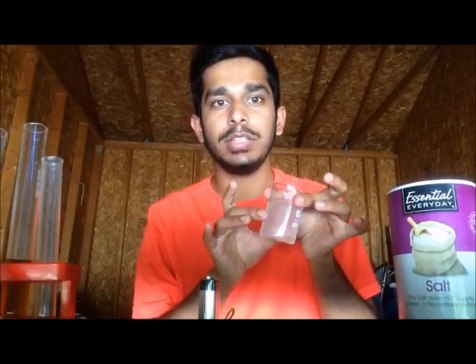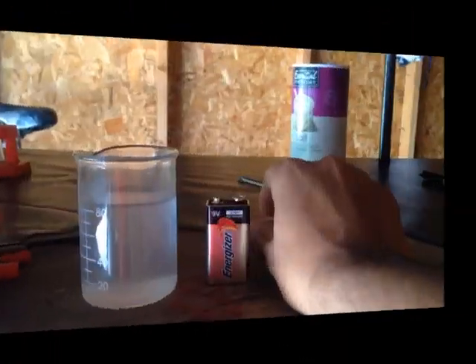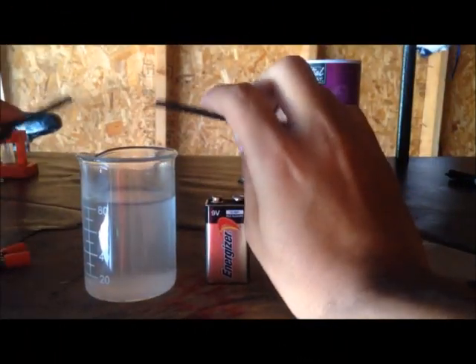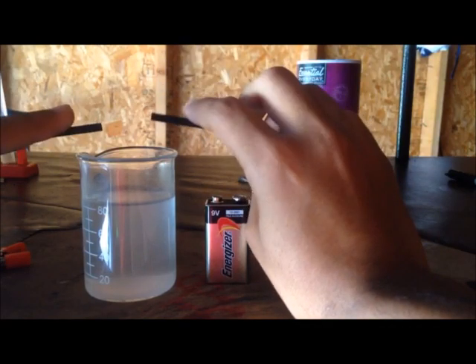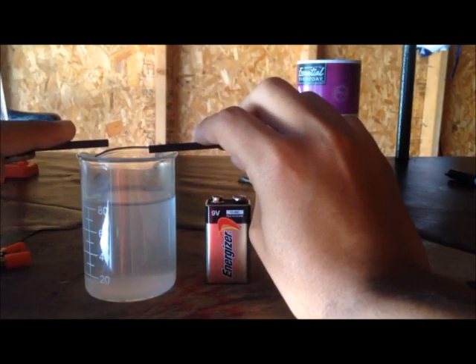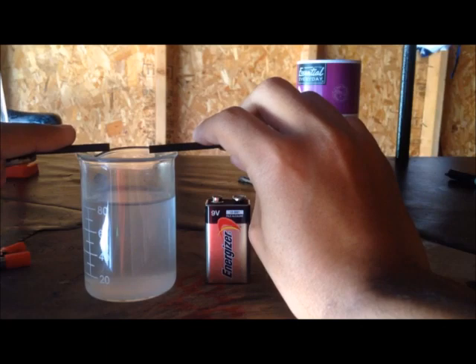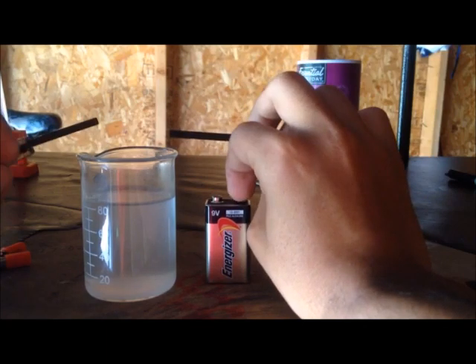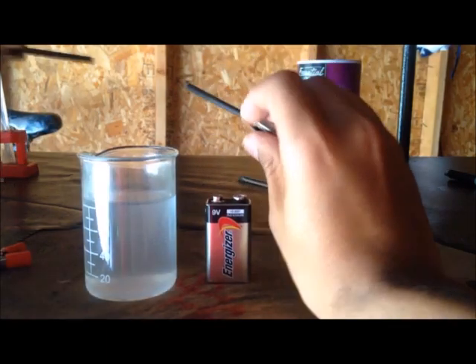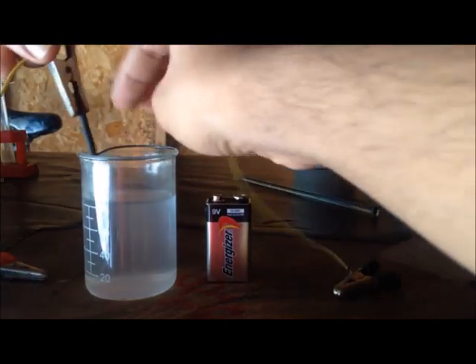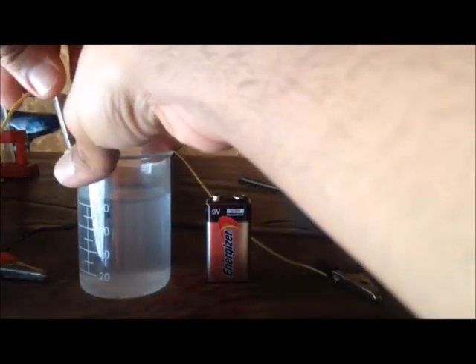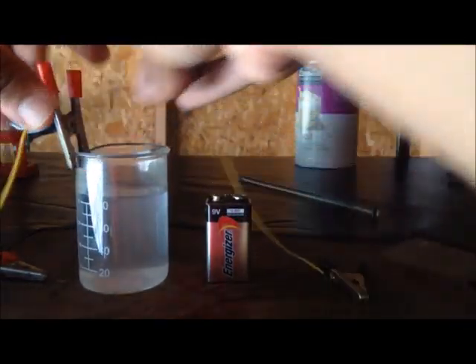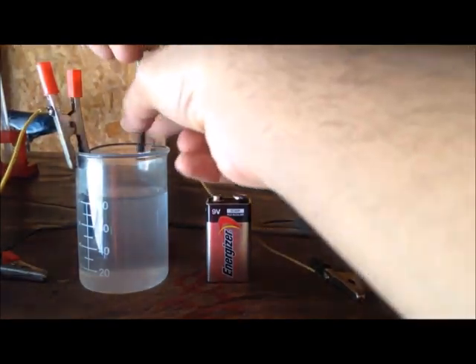This is nearly pure sodium chloride. For this electrolysis reaction I'll be using these carbon electrodes—graphite rods that I retrieved from dissecting dry cells. You can check out my video on dissecting a dry cell. The red one will be the anode or positive terminal, and the black one will be the cathode or negative terminal.